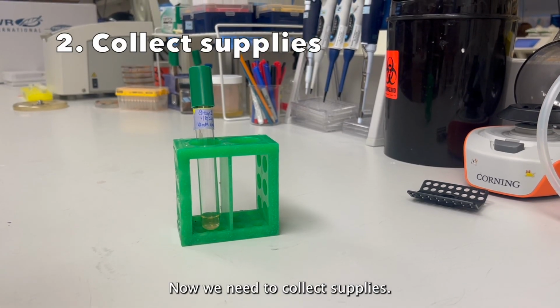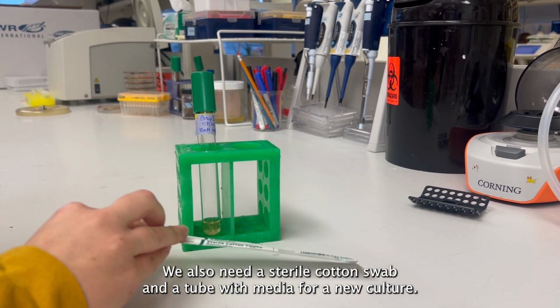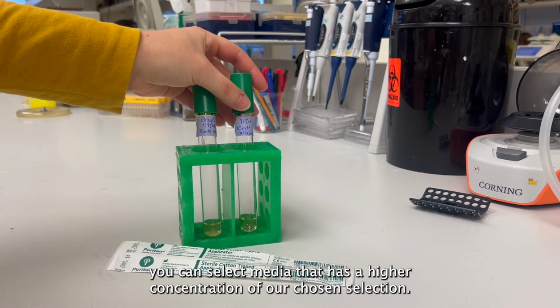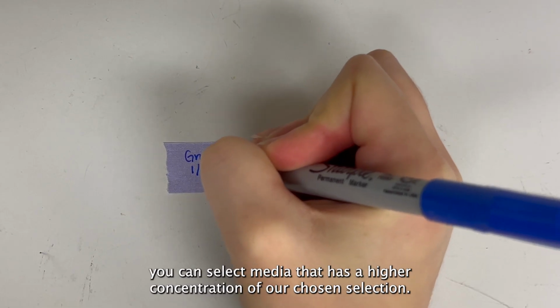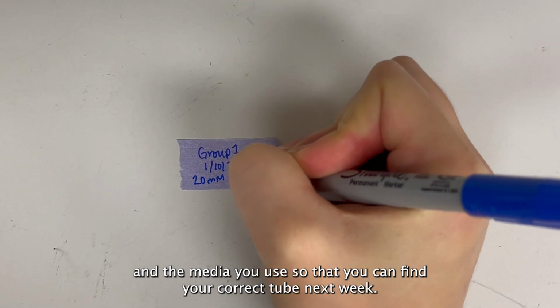Now we need to collect supplies. We have our previous culture. We also need a sterile cotton swab and a tube with media for our new culture. If your yeast grew well, you can select media that has a higher concentration of our chosen selection. Make a label with your group name, the date, and the media you use so that you can find your correct tube next week.